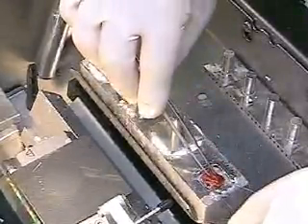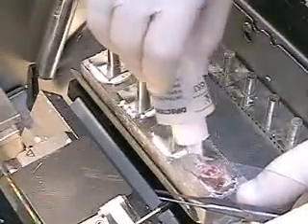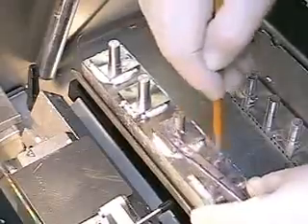Now, at this point, if we would like to label them, we can easily take a pencil and label these chucks from behind — 1, 2, 3, 4 — and these are all ready to come out.